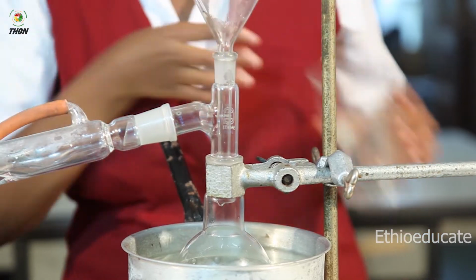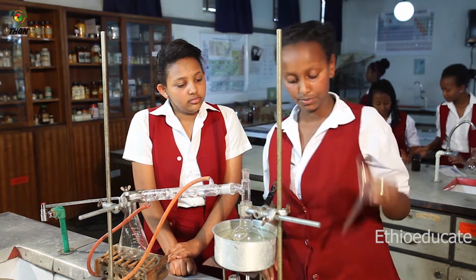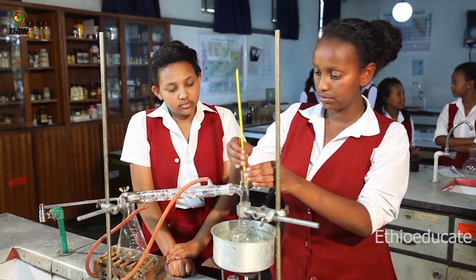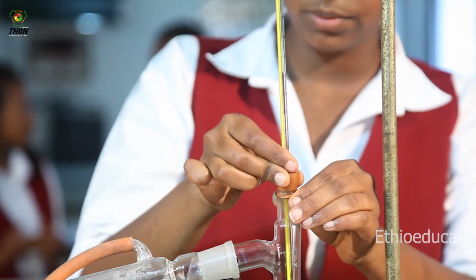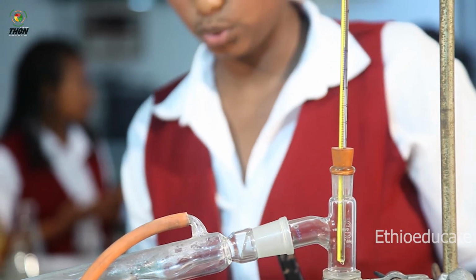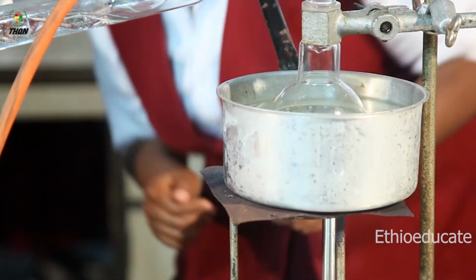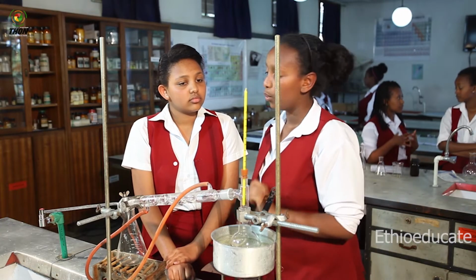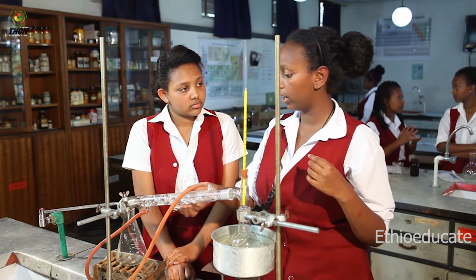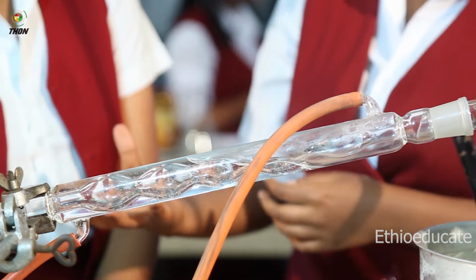To put it under a water bath. So now, after I've inserted my mixture, I put the lid back on. Okay. So I need to have a source of heat, which is what the Bunsen burner is for. So now it's on. Then, as I told you earlier, when the more volatile liquid starts to evaporate, it needs a source of water so that it can cool it and condense it back into liquid.